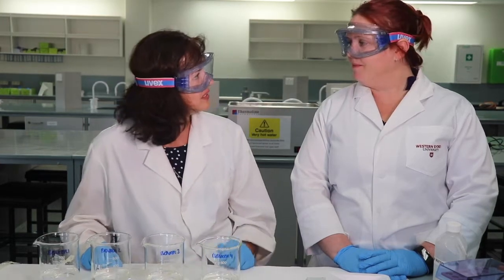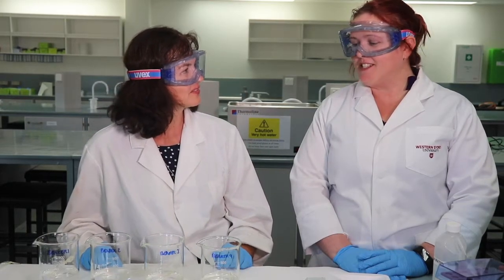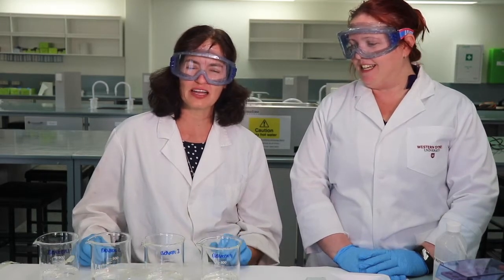And what we're interested in, of course, is the change in weight over time. So the bags may increase in weight. And what would that be an indication of, Fiona? Probably things moving into the bag. And sometimes the bags may lose weight. They may become lighter. And that would indicate what? That something's moving out of the bags. So we'll leave you to run that experiment for 80 minutes, and your tutor will discuss the results of this experiment with you.